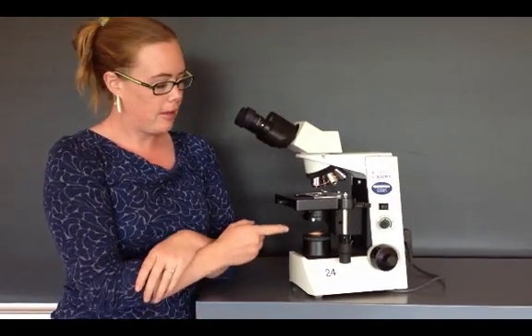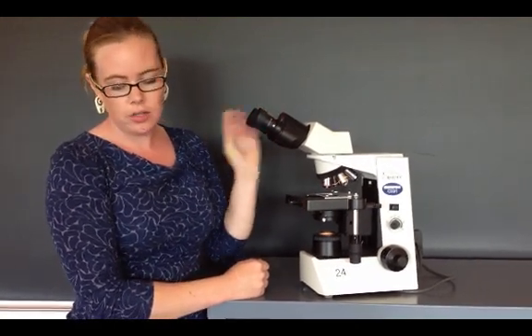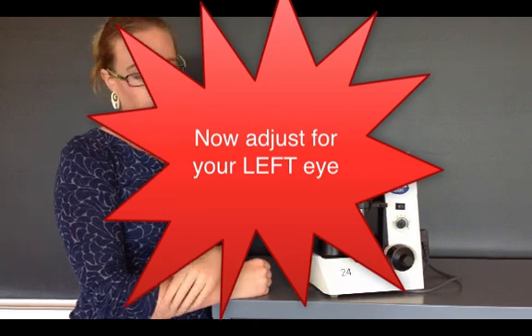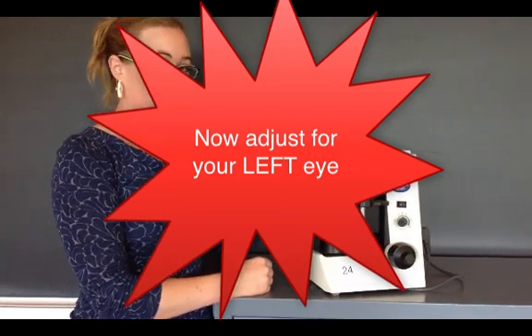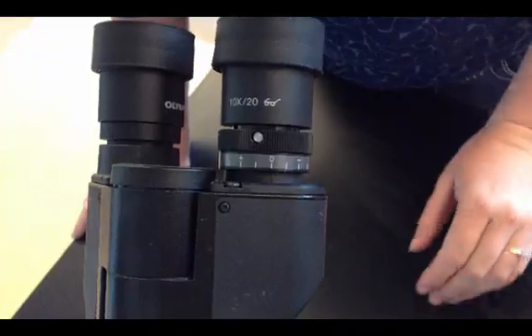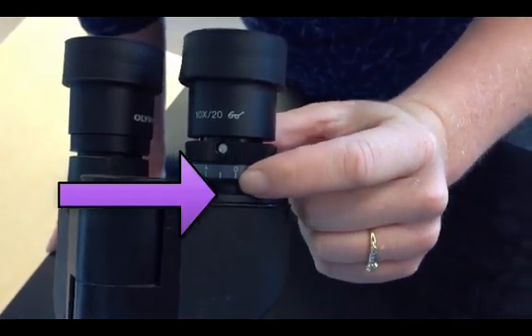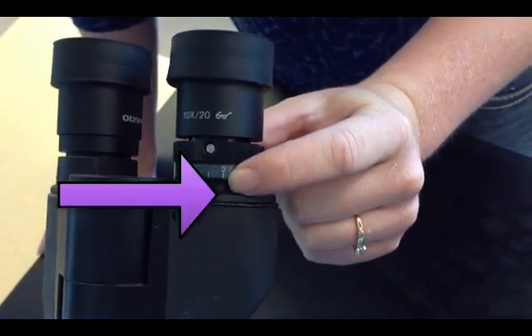Now that the microscope is adjusted, you can adjust the eyepiece. So now you're going to open up your left eye and close your right eye. And then adjust the microscope for your eyes. Start out by lining the zero up to this very small black line on the microscope.